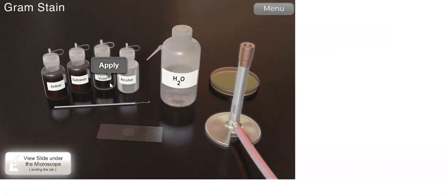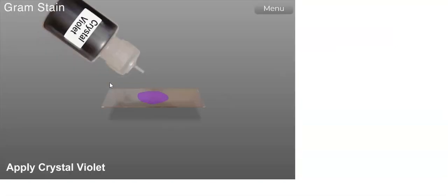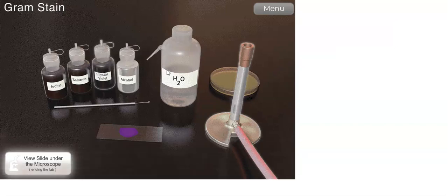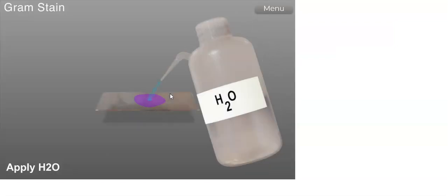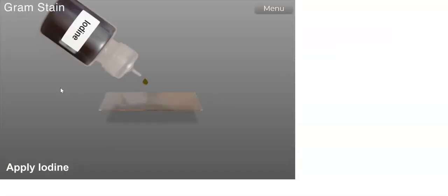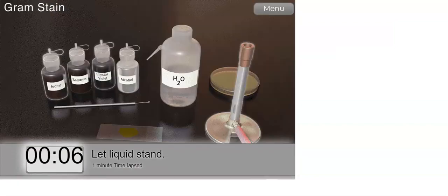So the first initial staining solution, which is crystal violet, is added, and let that liquid stand for 1 minute. After that, rinse with distilled water to remove the excess crystal violet. Then we're going to add a few drops of iodine.